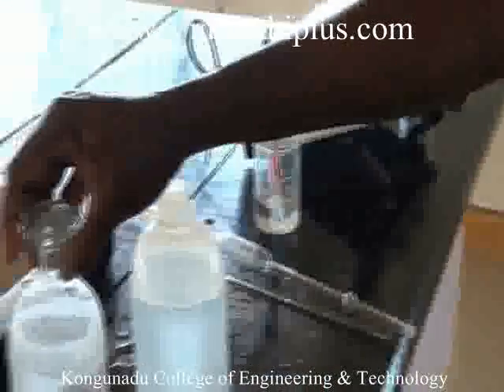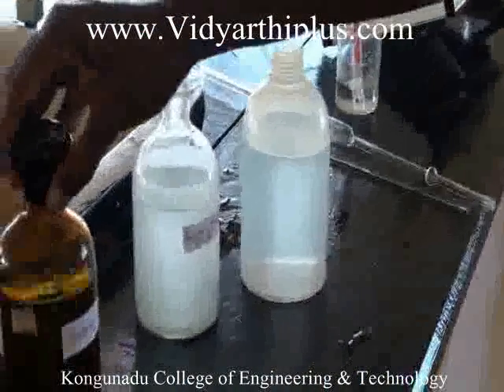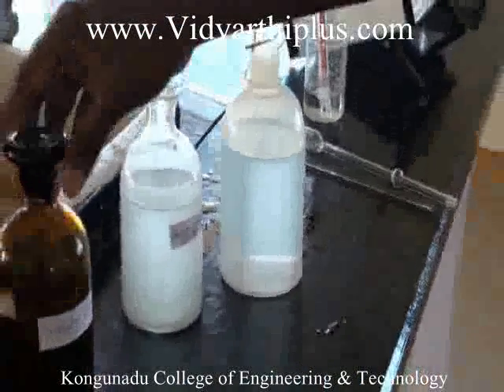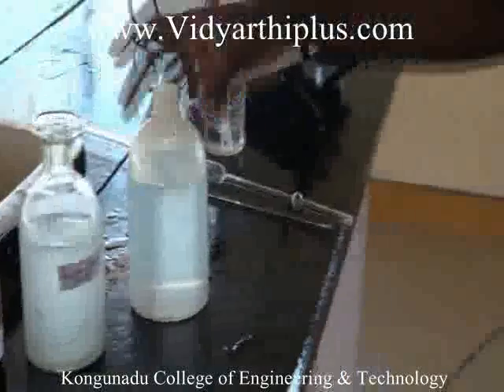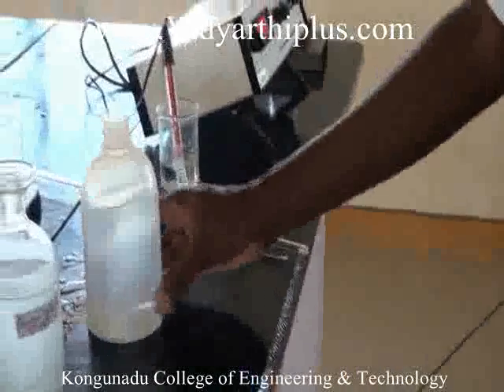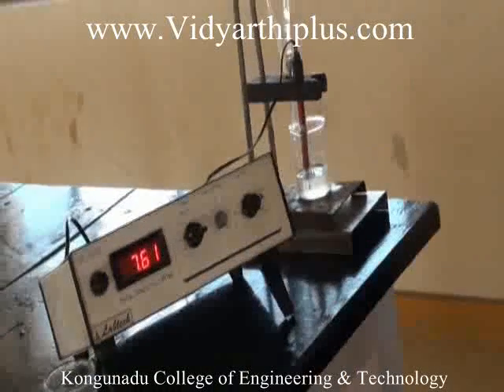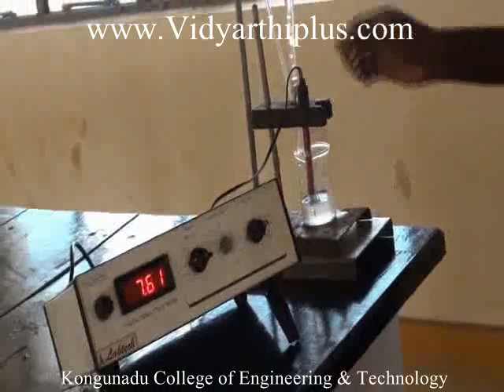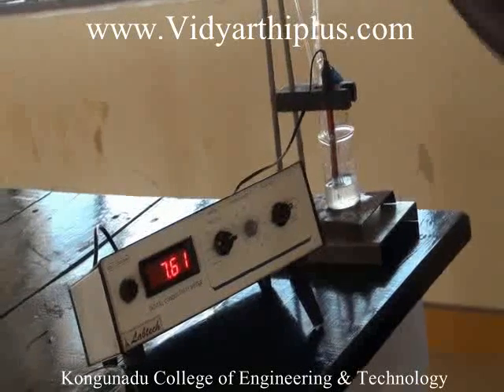The chemicals required for this titration are sodium sulfate, barium chloride, and distilled water. Now let us do the titration.